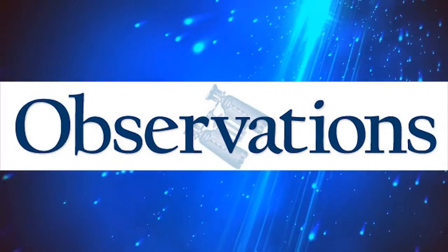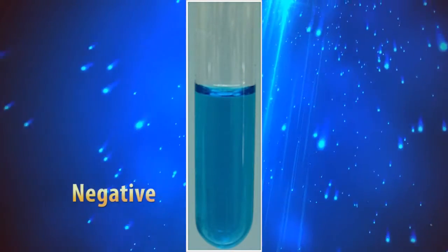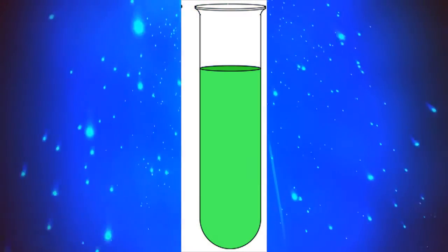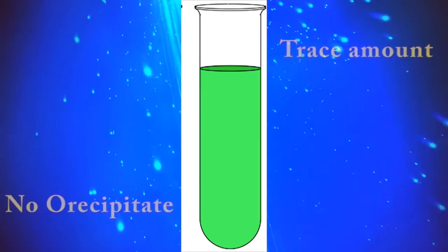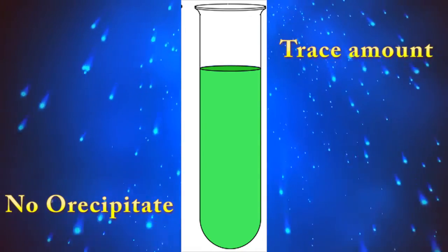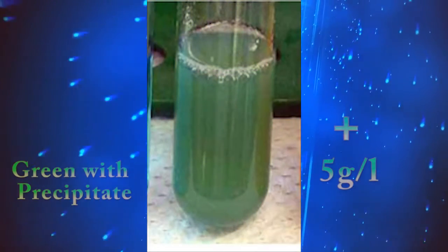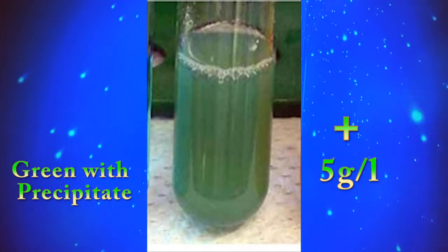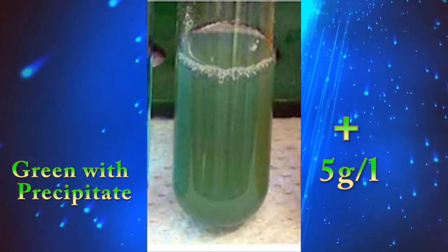Observations: If color does not change, the urine sample is absent of glucose. If color changes to green with no precipitate, the urine sample contains a trace amount of glucose. If the urine sample changes to green with precipitate, we can give a single plus sign.